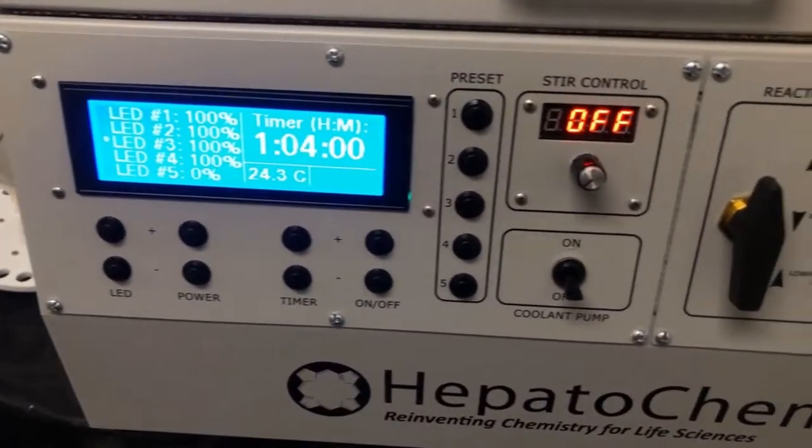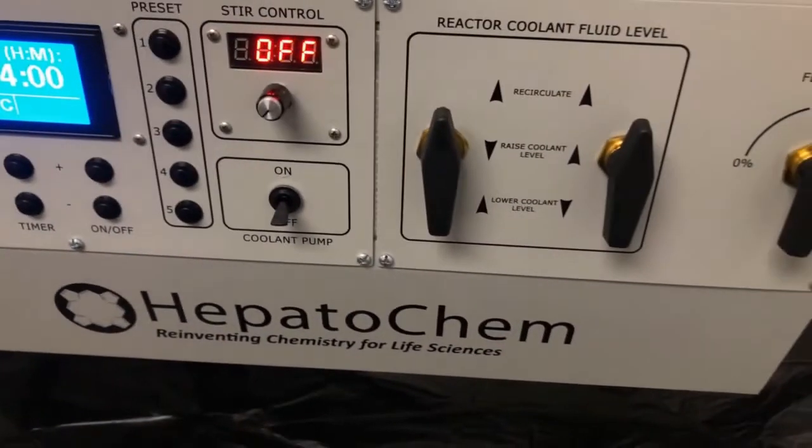Today we're going to do a quick demonstration of the Lucent 360 by showing how easy it is to set up a reaction.